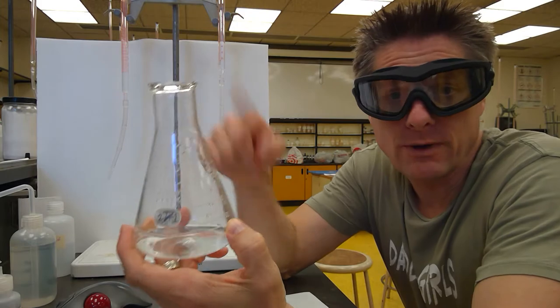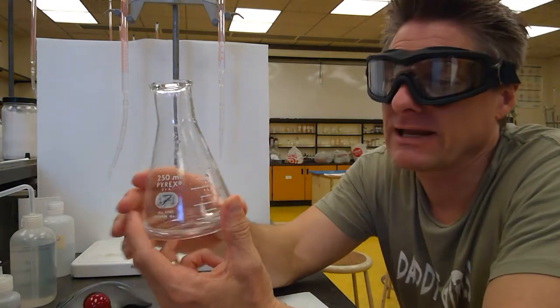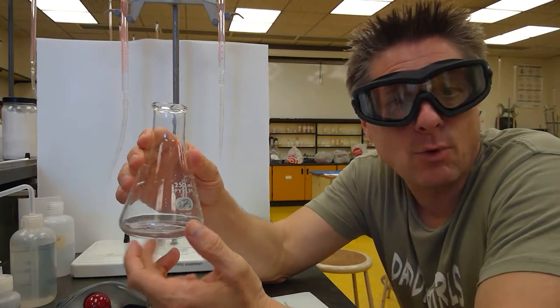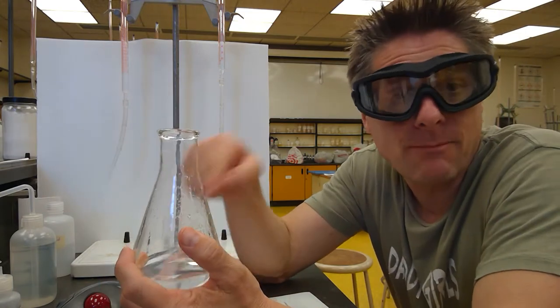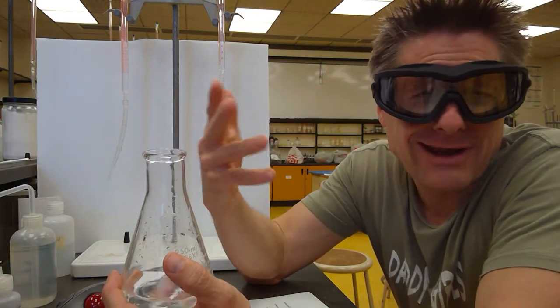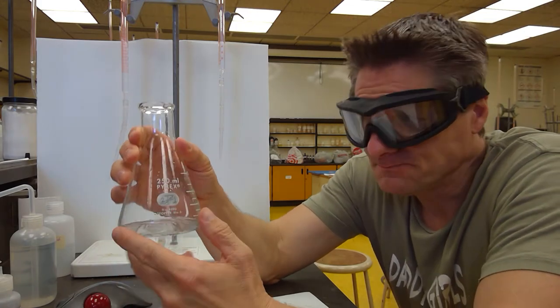We could switch it all. We could put a base here and an acid here and another base there. But typically we're titrating an acid. So I have a known volume of acid. However you got that acid in there is important. Maybe it was a solid that you weighed and dissolved. Maybe it was measured from a burette, or a graduated cylinder, not as accurate as a burette usually. And we give it some volume in there.